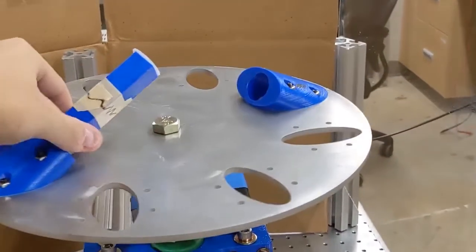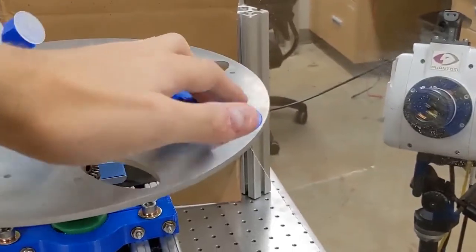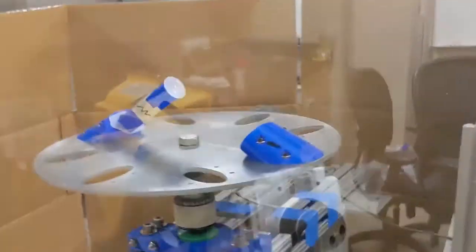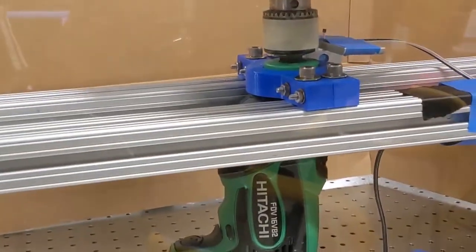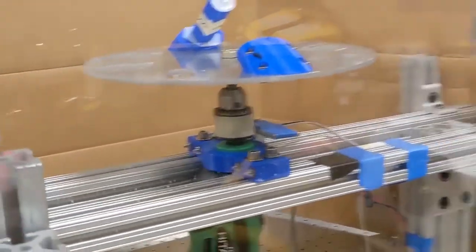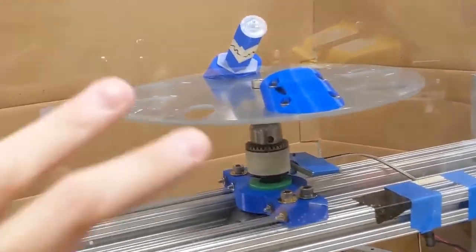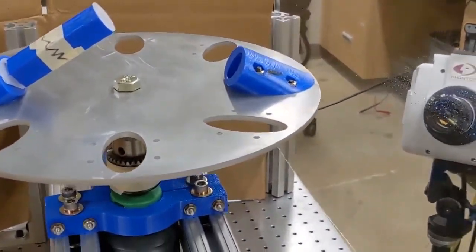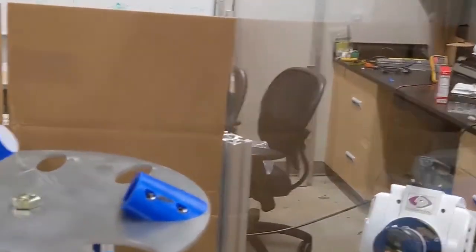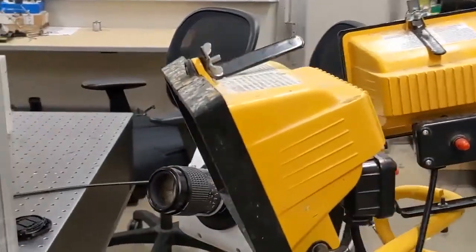Basically, we're going to have 2 syringes here. This is one syringe, and there's going to be another one here. The syringes are mounted in just a hand drill. We made this setup because we want to take some pictures, so we wanted it to be a little rigid. Of course, we want to make sure that it's not going to blow up, so we have a little plexiglass here to keep us safe, and we have our Phantom camera recording it.